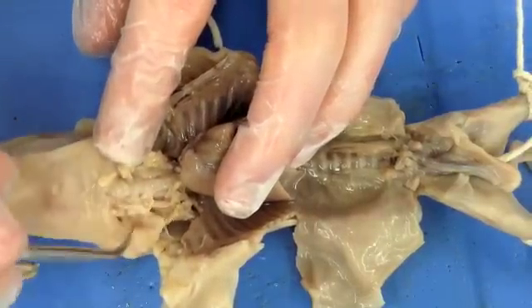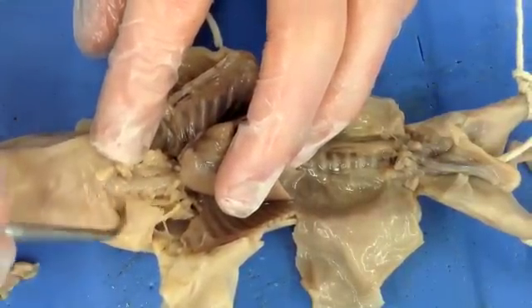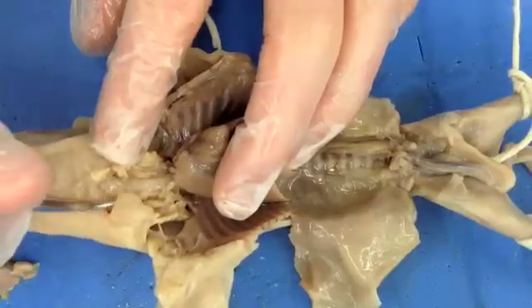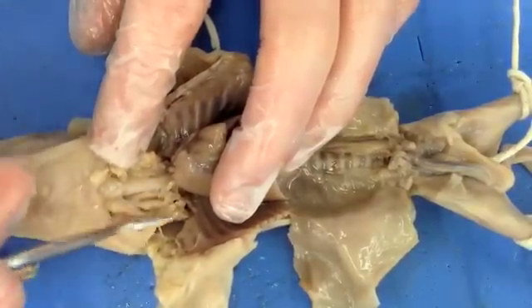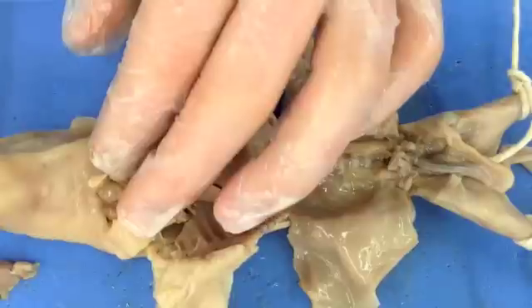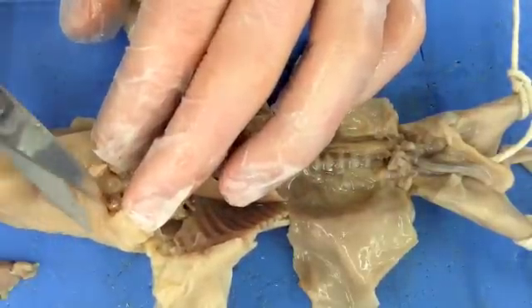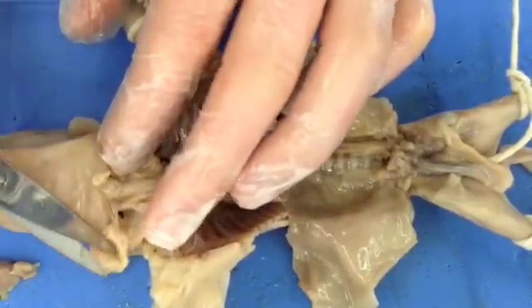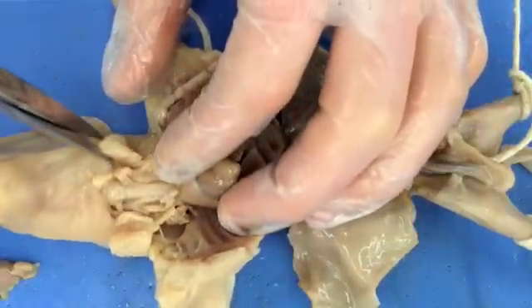Up here is your pharynx and your larynx — your voice box is up in this area. We've got this connective tissue here, and let's try to remove that back a little bit.